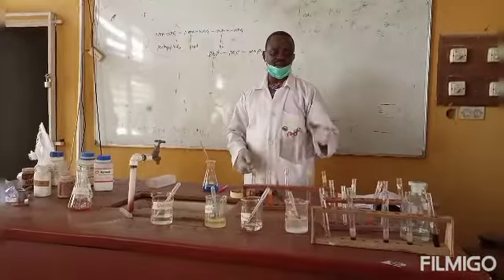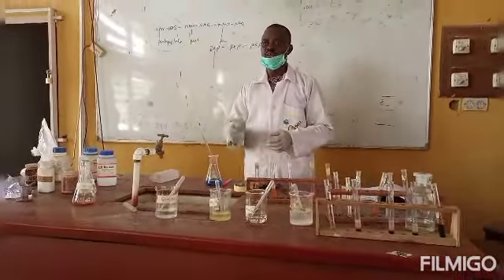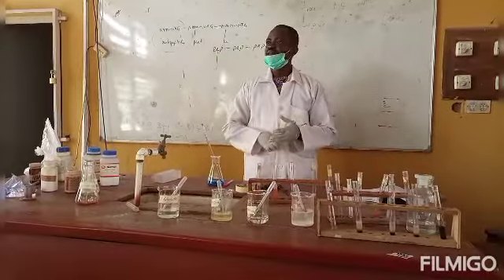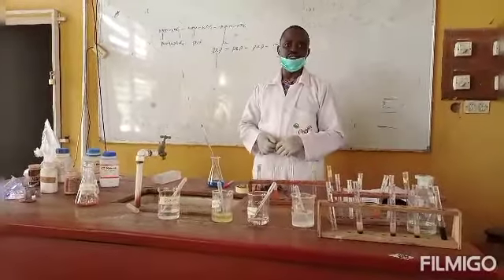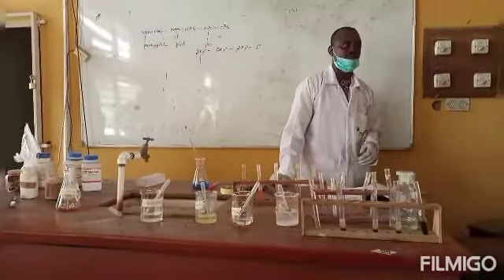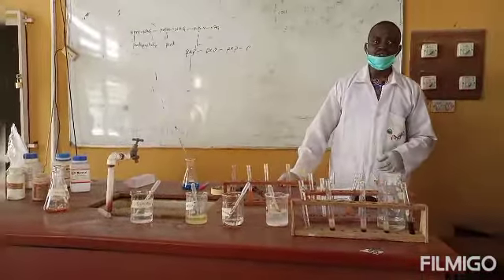The next reaction we shall be taking a quick look at is a test for sucrose. We have already carried out the Benedict test for sucrose in the first reaction, but we want to carry out a further reaction on sucrose. First, we will carry out acid hydrolysis on it. Don't forget the other time Mr. Moses was telling you that sucrose contains 2 monomeric units of sugar, glucose and fructose.